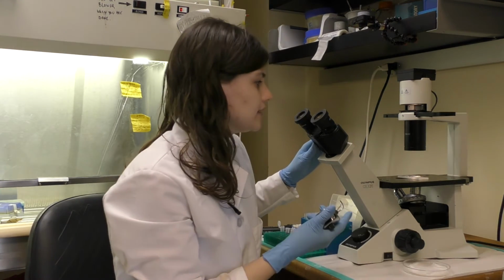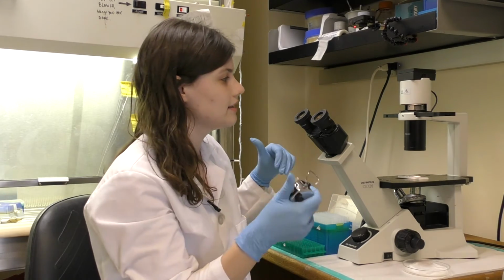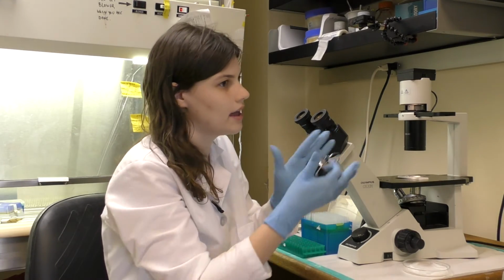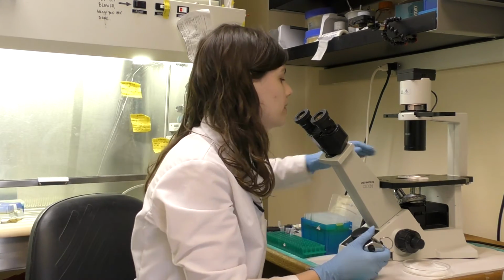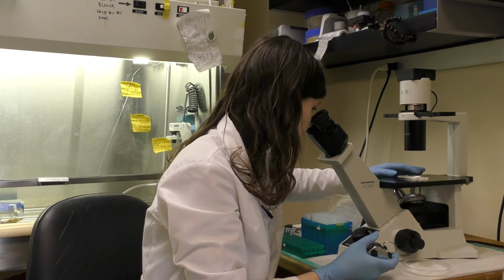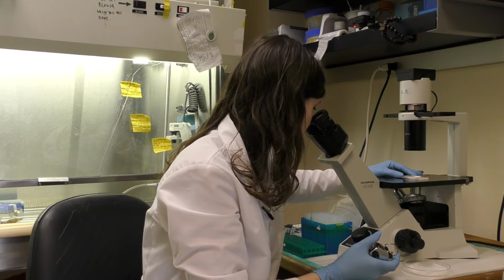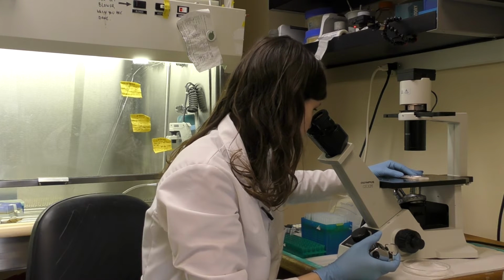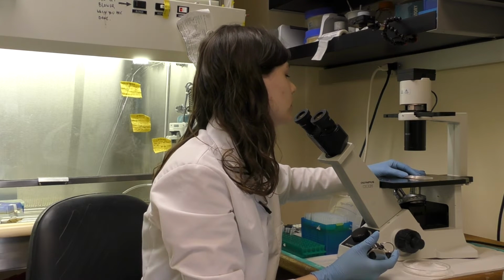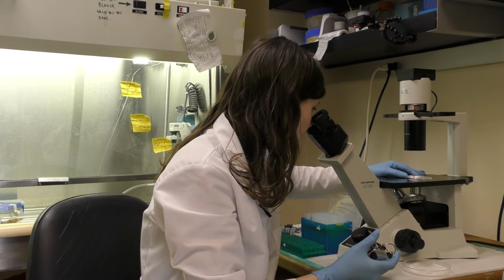And then also come up with a system so that you're being consistent, so only the cells on lines that are closest to the insides will be counted, and the cells that are on the line or on the border on the outside won't be counted. And so we're going to go ahead and count all of these. So that was one side, and then I'm going to move it over to the second side, and I'm going to repeat.